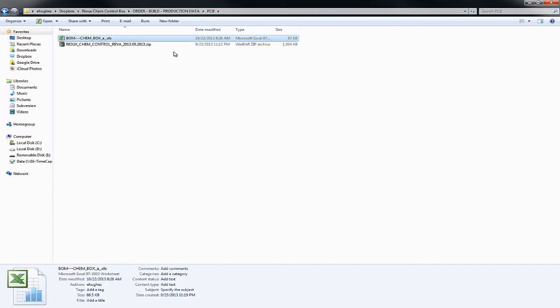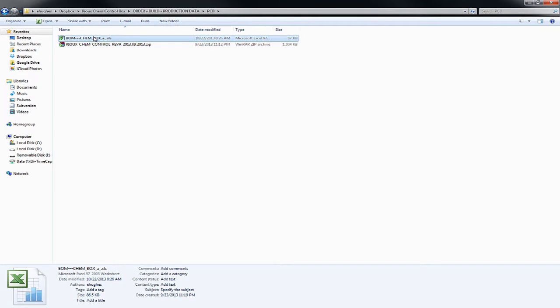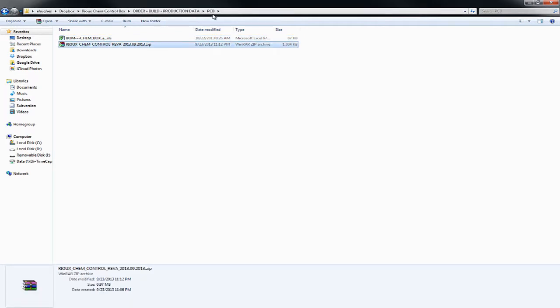Right now I have version A listed out in the zip file. This zip file is what you give to a circuit board manufacturer. These are called the Gerbers that you use to make the PCBs. It has everything they need. So the first 5 or so that we made, these are the files that we used. And the BOM just has the production data, the actual parts you need to put on the board.